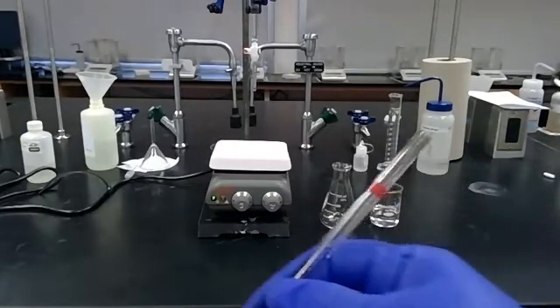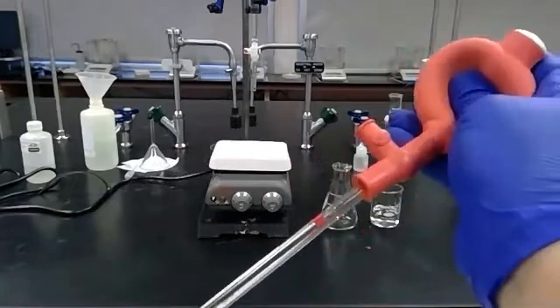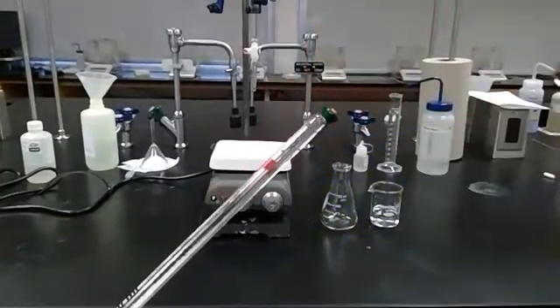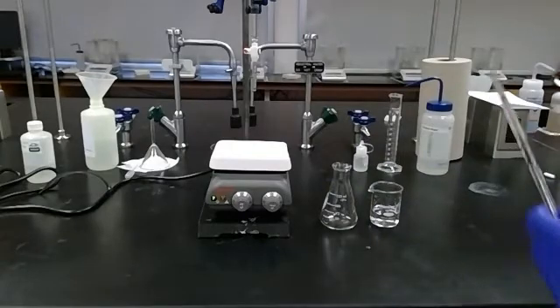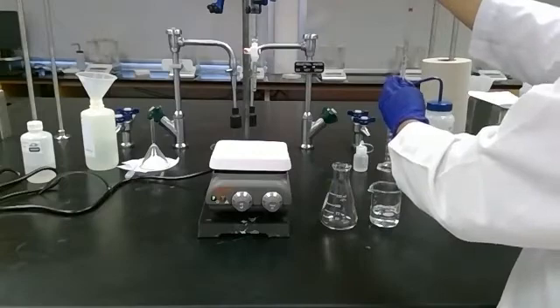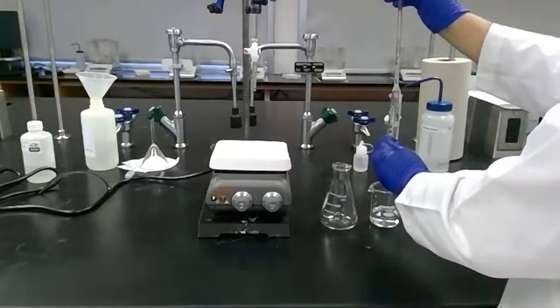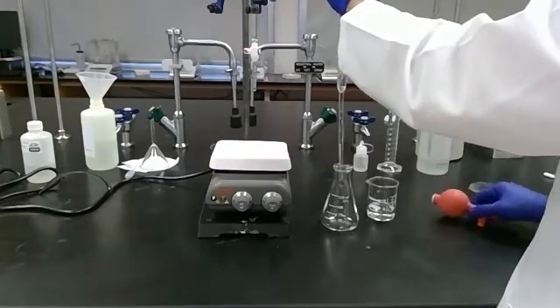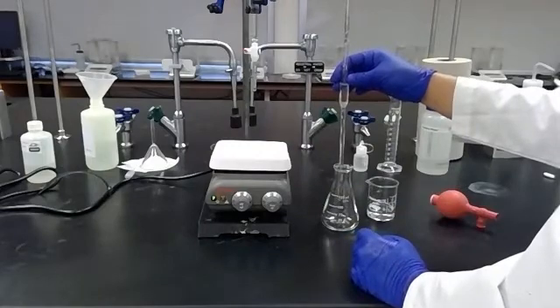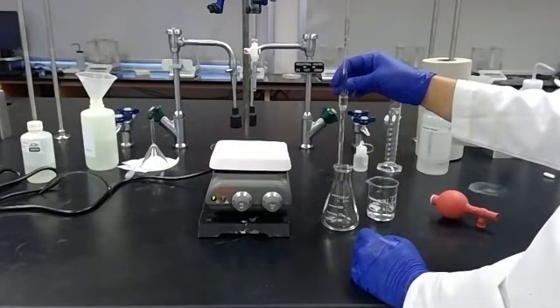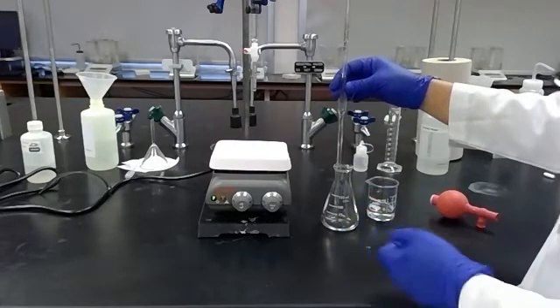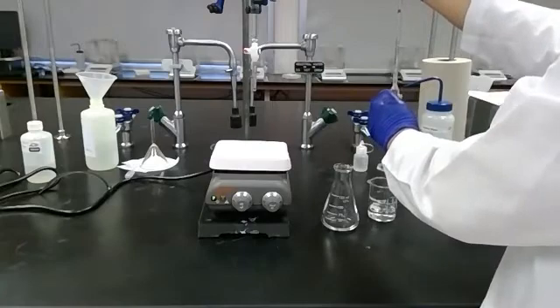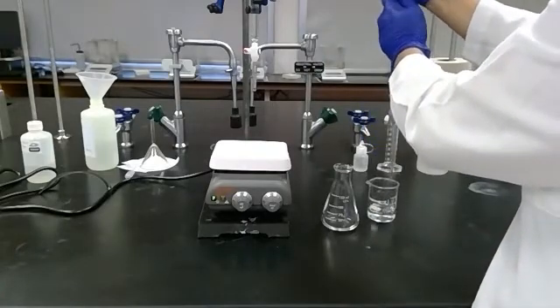I'm going to use a bulb which I can press all the air out of and put on to the top. Then I'll be able to use these arrows up and this arrow down to control the volume inside the pipette. Before I use it, I'm going to condition my pipette. I'm going to take up 10 milliliters and condition this three times. I've already done it twice. I'll do this process three times to make sure that any residue inside this pipette is really just residue from that unknown acid that we're interested in.